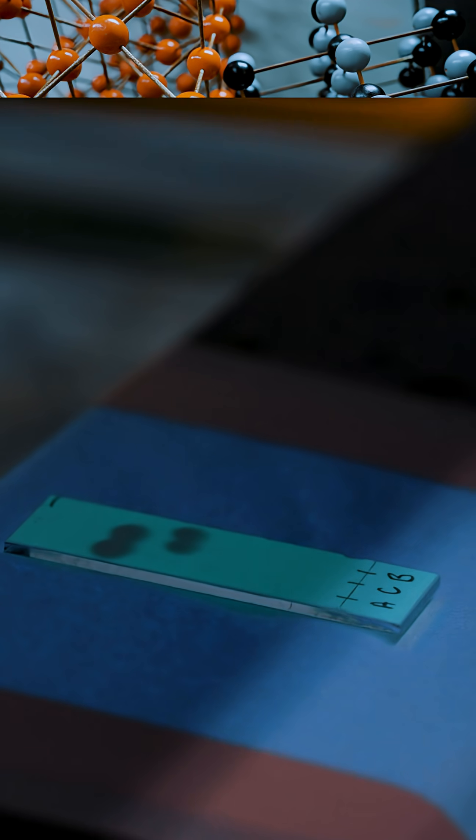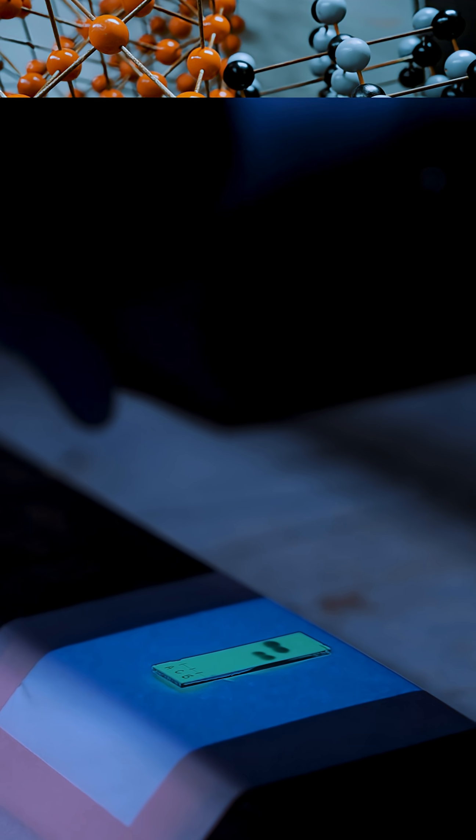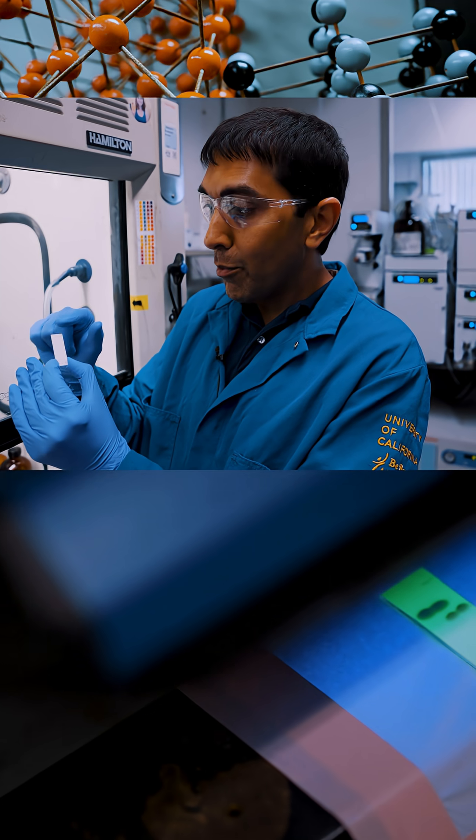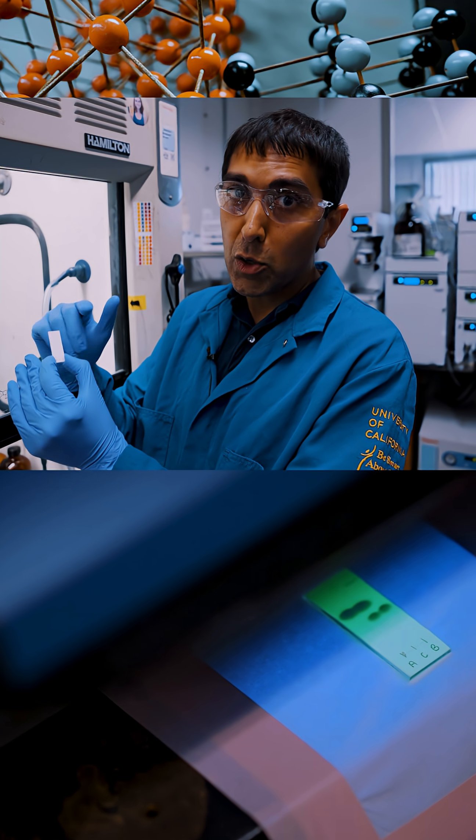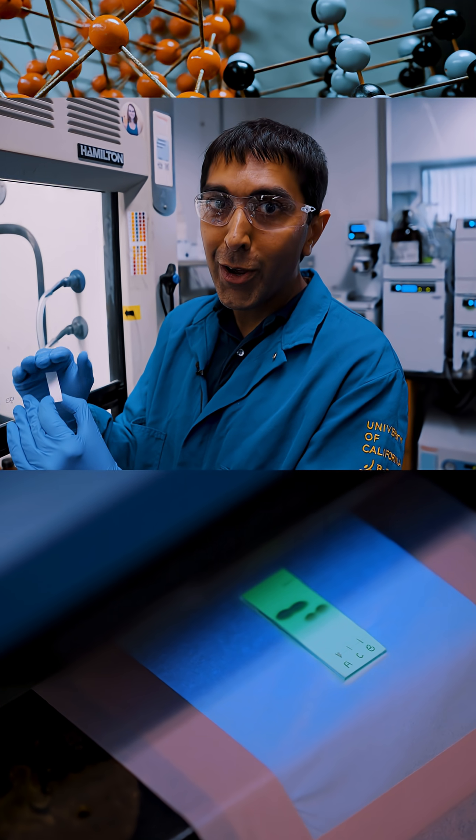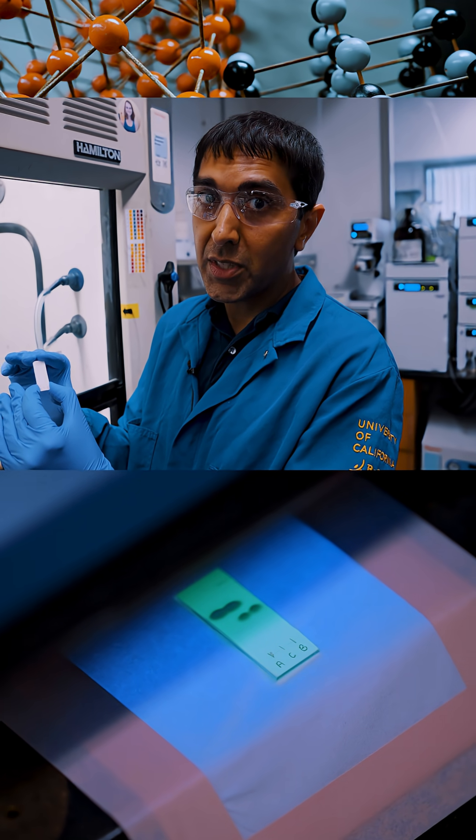And we'll be able to look at that under UV light because the chemicals have slightly different structures. They will move differently on this plate. So one will move faster than the other, ultimately allowing for the two chemicals to separate.